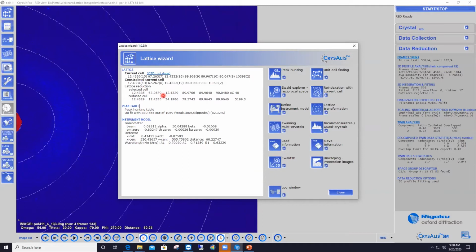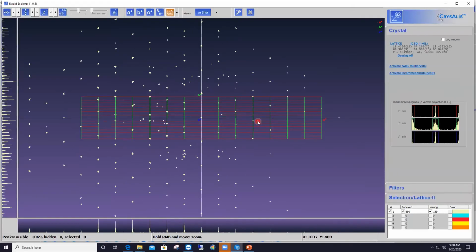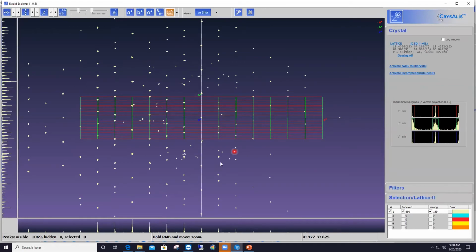And that makes, as a result, for a huge unit cell, especially for a compound that has barely 20 non-hydrogen atoms. So something is a bit fishy there, and of course, then you want to look at your reciprocal space. And the lesson here is that even if you have a high percentage of reflections indexed, you should always, always, always look at your diffraction pattern in the reciprocal space. You will see things in the reciprocal space that you can't see otherwise. So I click on the Ewald Explorer button, and that's what everything looks like. Let me increase the size of the reflections so you see better what I am about to show right now.